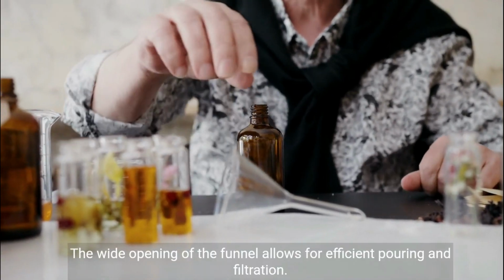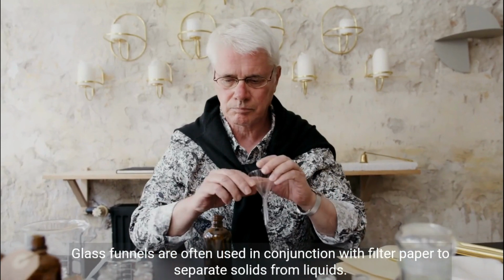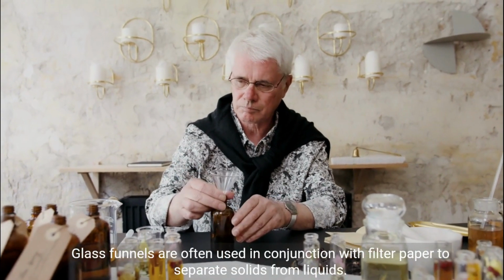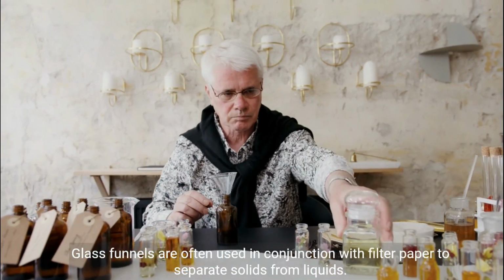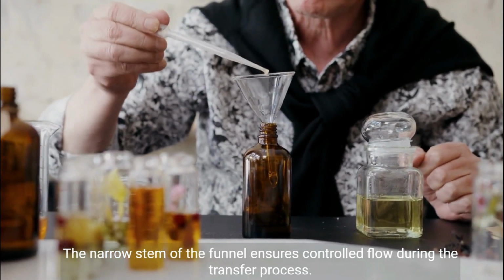The wide opening of the funnel allows for efficient pouring and filtration. Glass funnels are often used in conjunction with filter paper to separate solids from liquids. The narrow stem of the funnel ensures controlled flow during the transfer process.